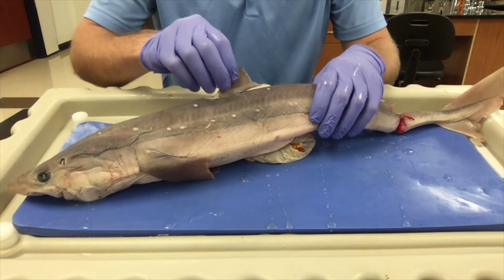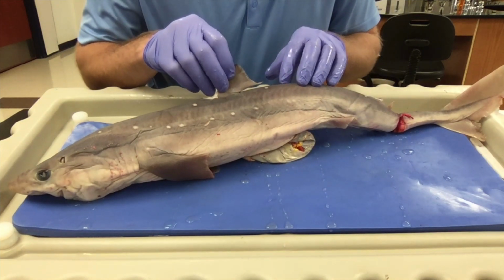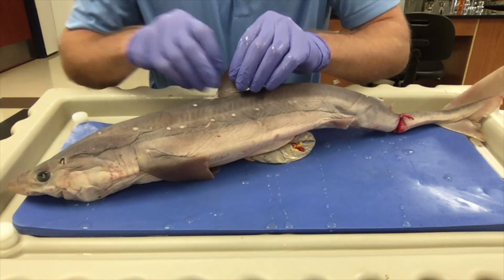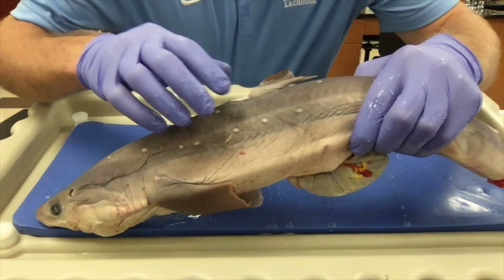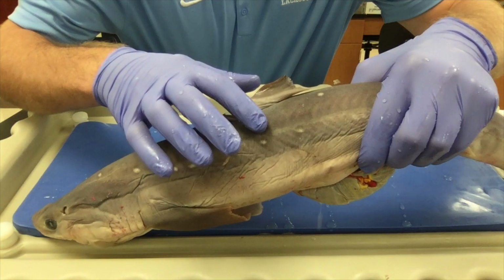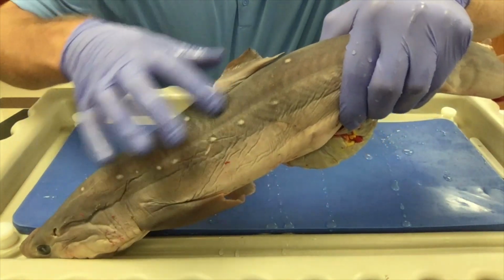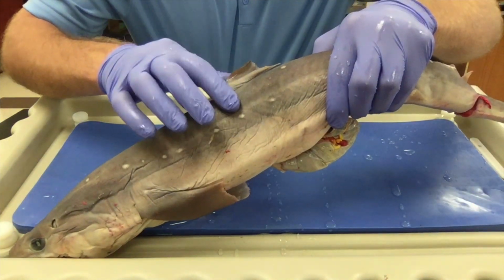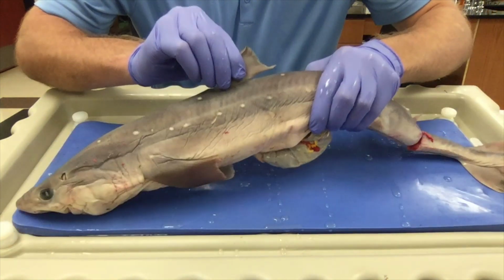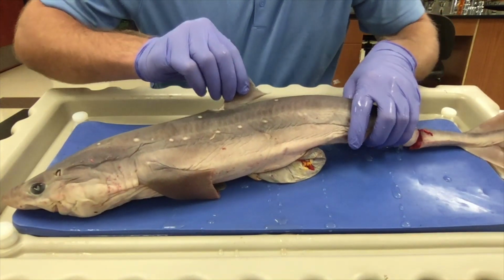First thing we'll notice is that the dogfish shark has roughly the same external anatomy as the perch. Many of the same fins, but their scales are very different. If I rub the dogfish shark's scales, I want you to listen. You should be able to hear how rough they are, almost like sandpaper. Shark skin was used as a primitive form of sandpaper.